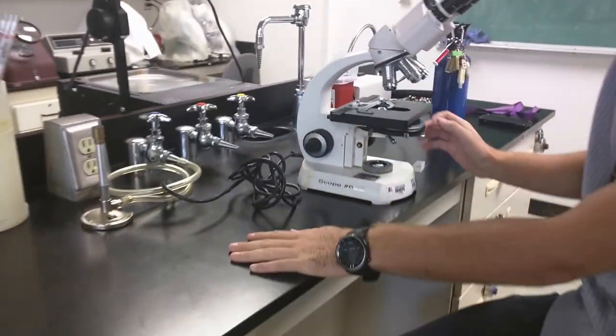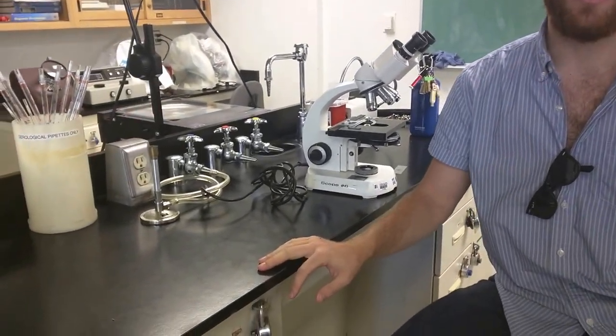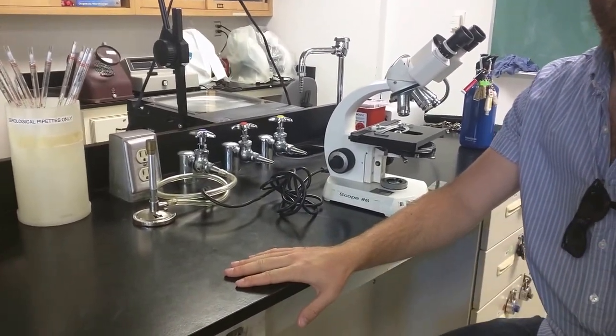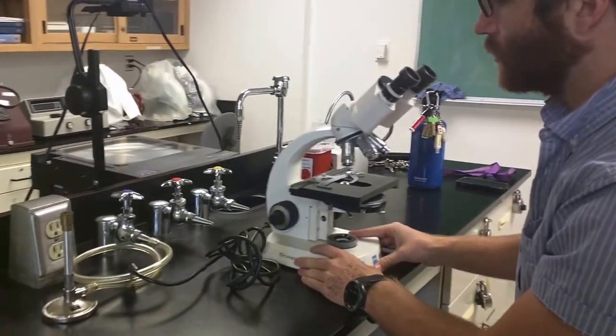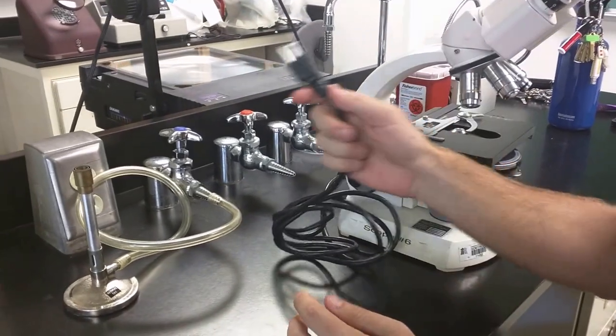In this video I'm going to show you how to use these light microscopes in 4209 Magnolia Hall. So this is for my Micro 315 labs. Anyway, so we'll make this really quick just for a review for you guys on YouTube or whatnot.